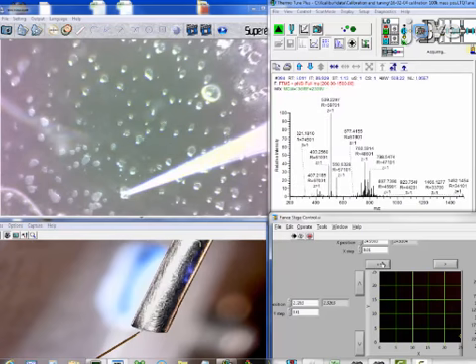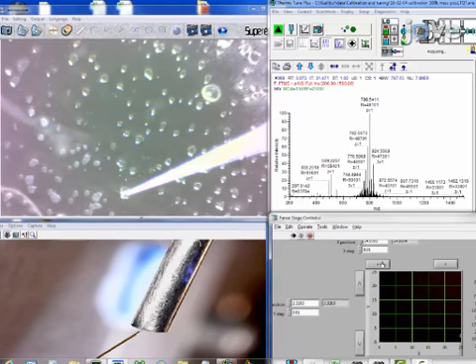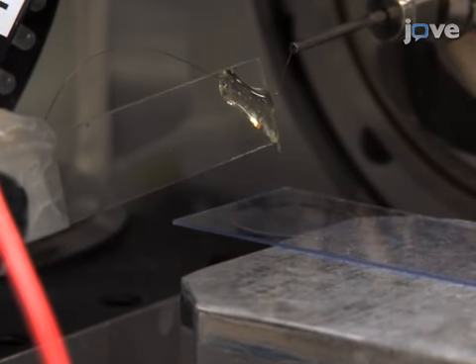Start MS data acquisition before the single probe tip is inserted into the cell. Lower down the cell-containing plate to pull the single probe tip out of the cell. Finally, let the solvent flow for approximately 3 minutes to completely flush the single probe.